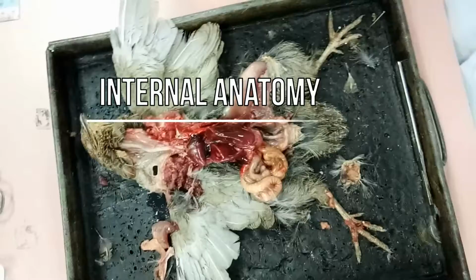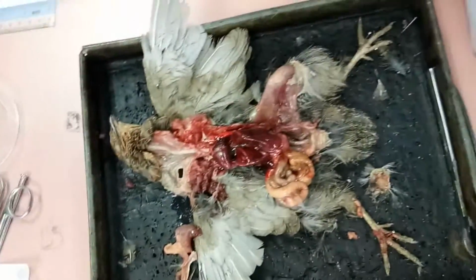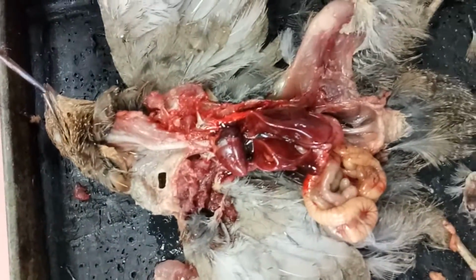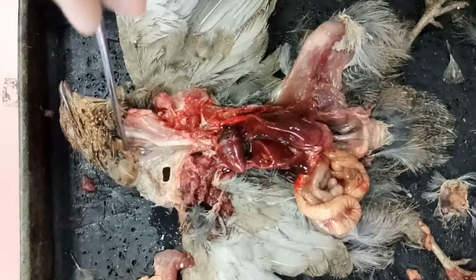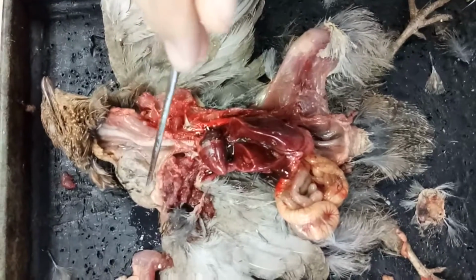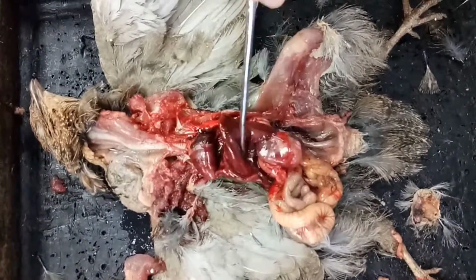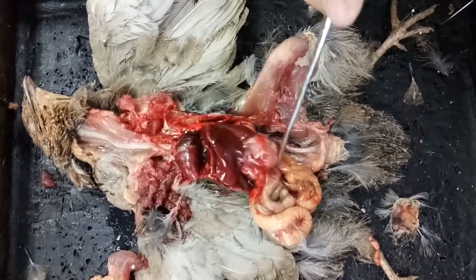We look at the internal structures of the bird. So we start from the digestive system. The food will come into the mouth, then enter the esophagus, then pass down into the crop for the temporary storage of food. After that, it will enter the gizzard for the grinding process of the food into smaller particles.